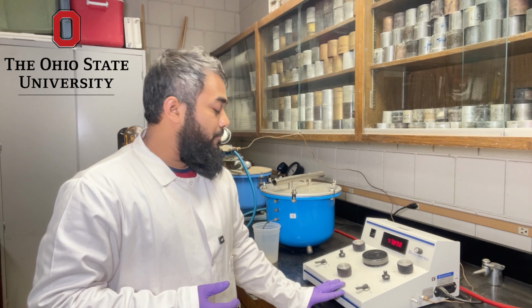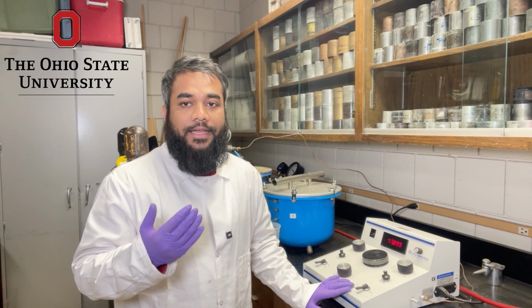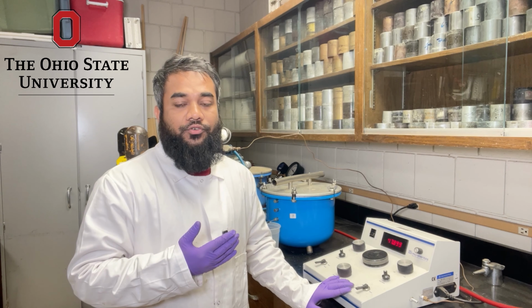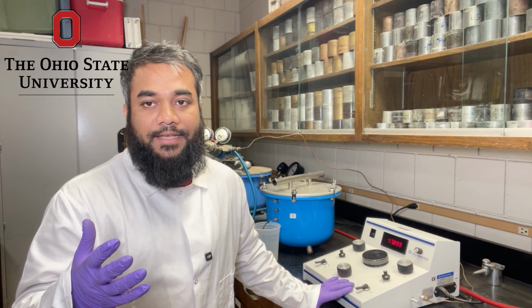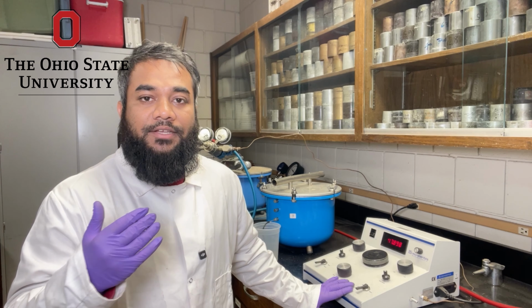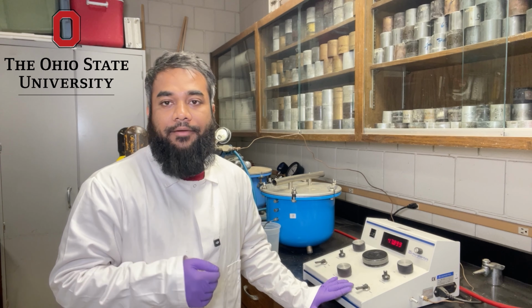Why is this digital pycnometer reliable? The digital pycnometer is highly accurate because gas penetrates micropores that liquid methods can't access. This makes it especially suitable for soils with fine texture or high aggregation.